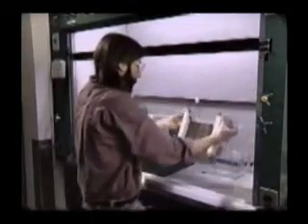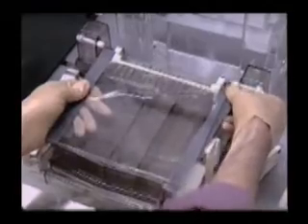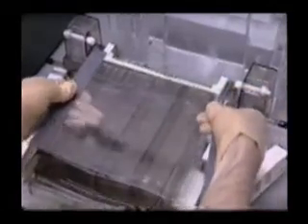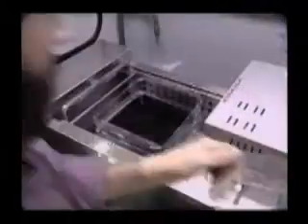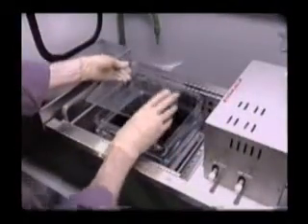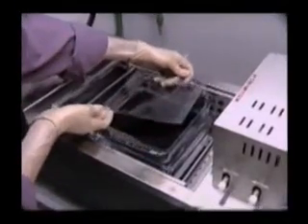Everything sort of requires some prior knowledge or prior experience. You can initially, for instance, run a gel and just get a rough idea of what kind of molecular weights you're dealing with. And then you might tailor your next gel so that its porosity is better suited for these samples. After the gel has been run, each size of protein will yield a band at the position it managed to reach in the gel.